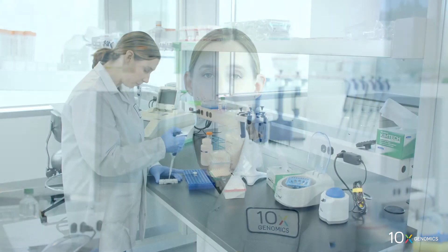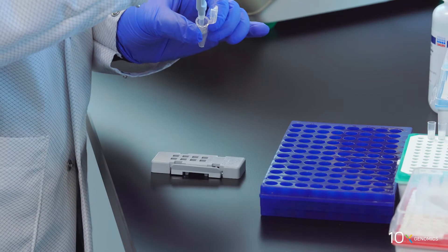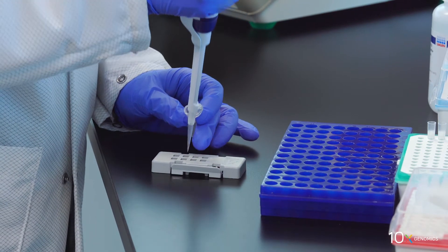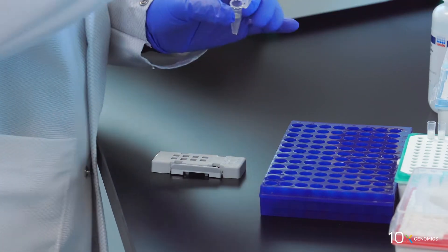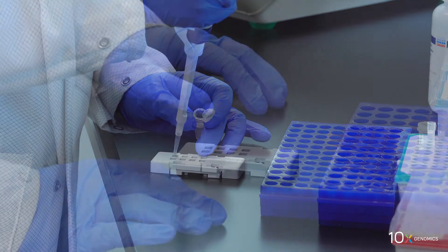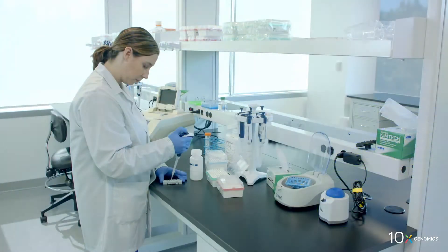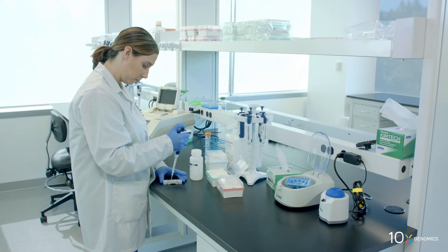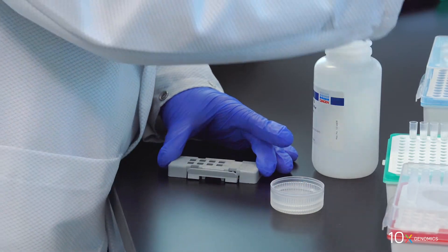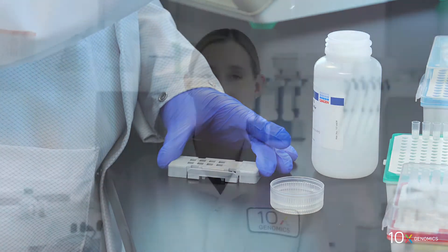Remove RT master mix from the wells. Add 75 microliters of 0.08 molar KOH, diluted from stock, to each well. Ensure accurate dilution of the KOH. Incubate five minutes at room temperature. Remove KOH from the wells and add 100 microliters buffer EB to each well.